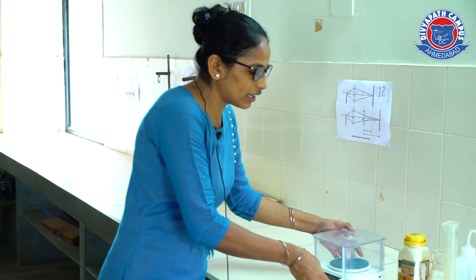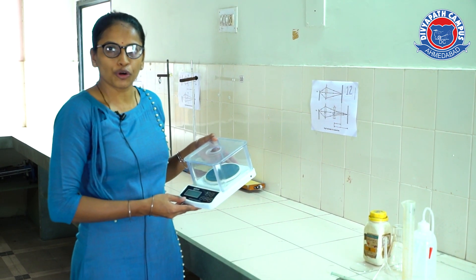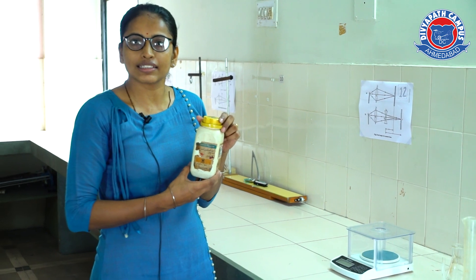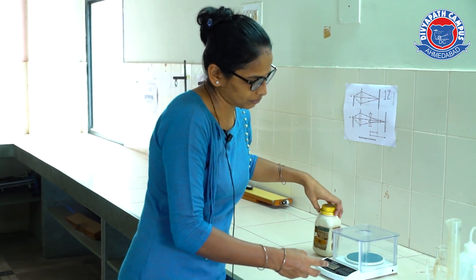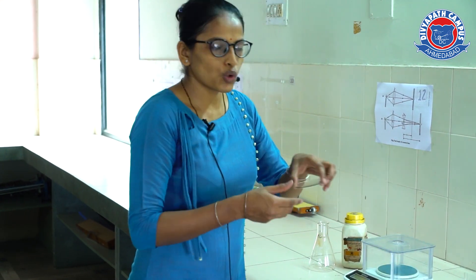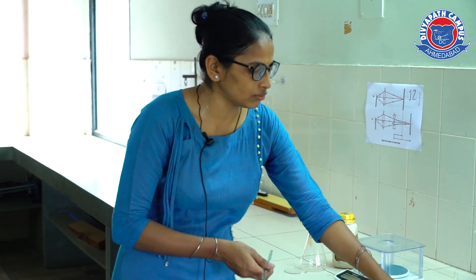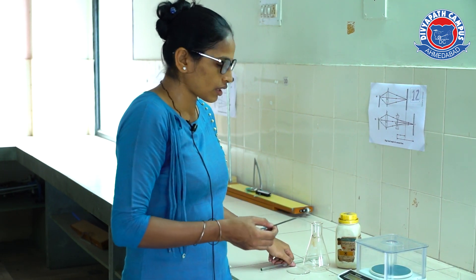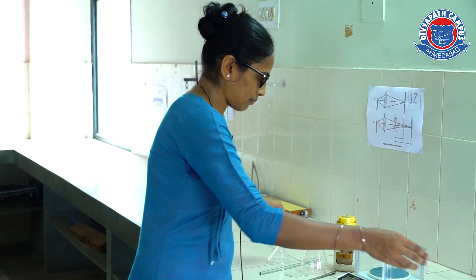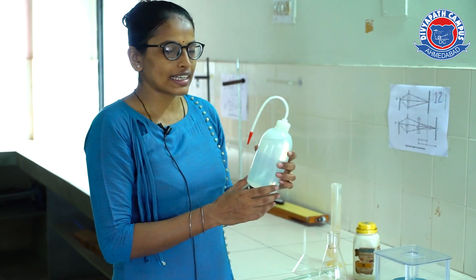For the experiment, we will need some basic things. First, this is the weighing balance — you need it for the exact measurement of oxalic acid mass. Next, oxalic acid powder, conical flask for preparation of solution, watch glass to carry the powder, glass rod to stir the solution, spatula, funnel, and measuring cylinder to measure the exact volume of oxalic acid and distilled water.